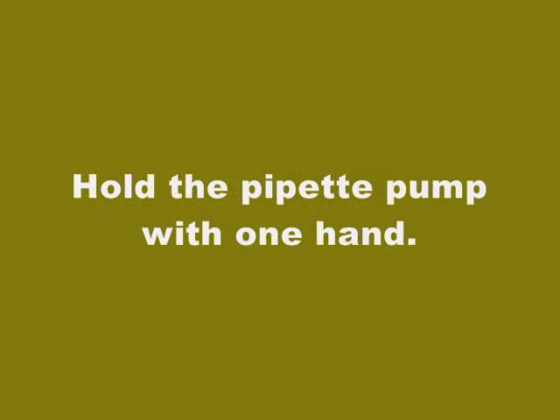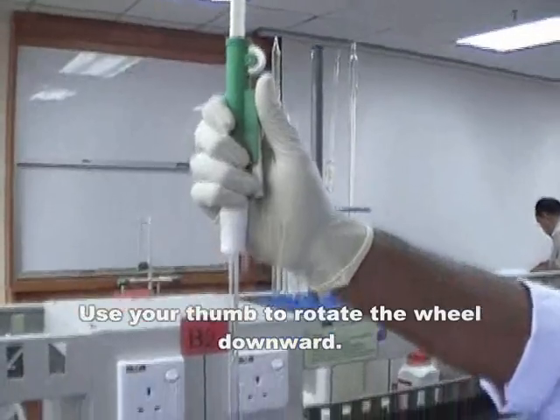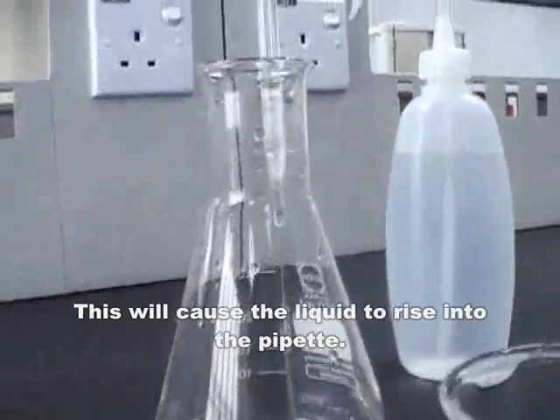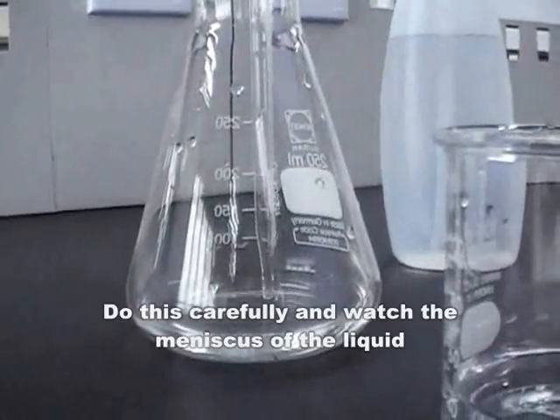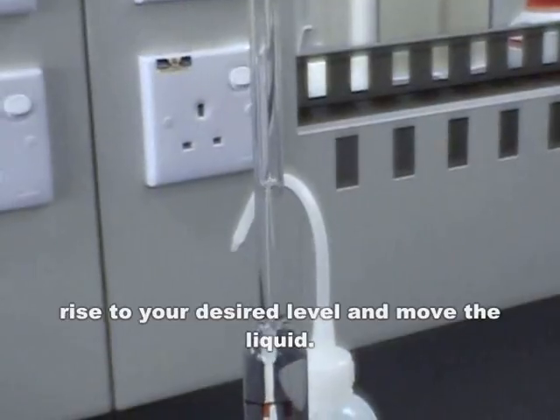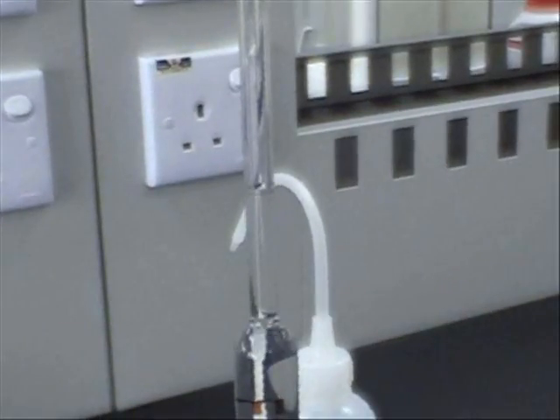Hold the pipette pump with one hand. Use your thumb to rotate the wheel downward. This will cause the liquid to rise into the pipette. Do this carefully and watch the meniscus of the liquid rise to your desired level and move the liquid.